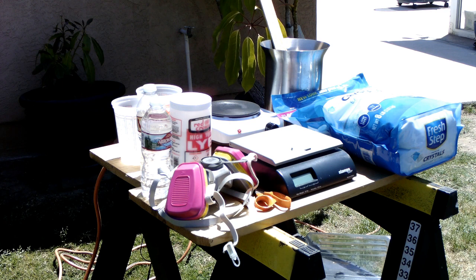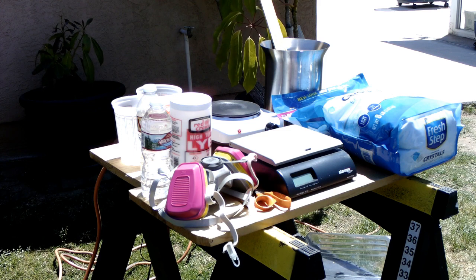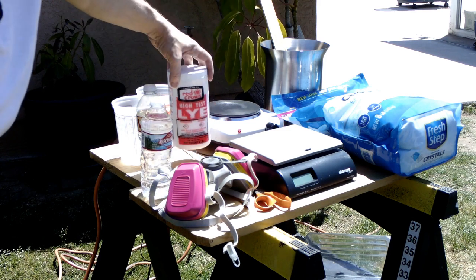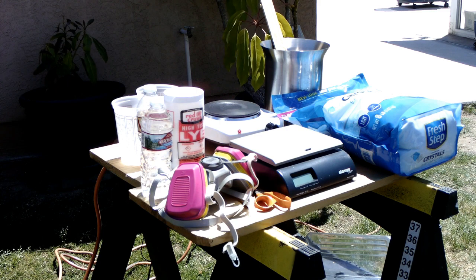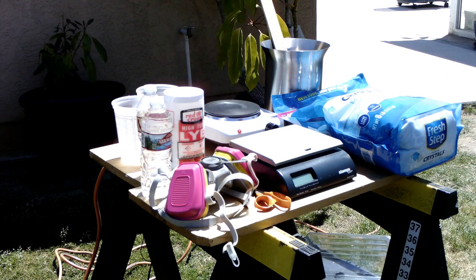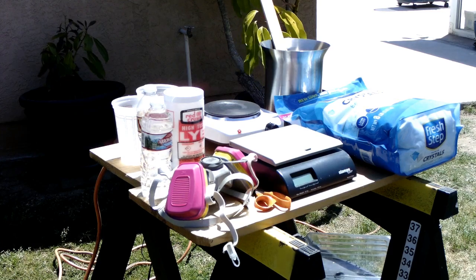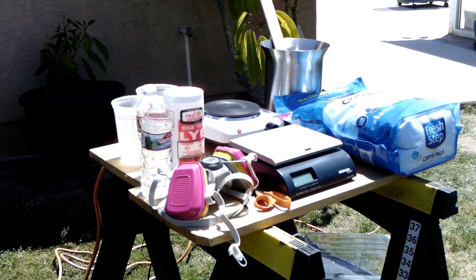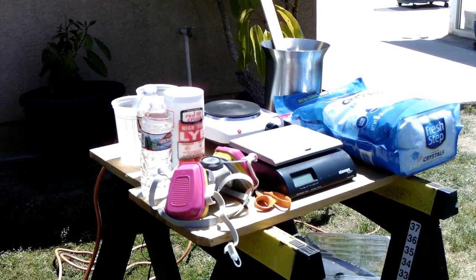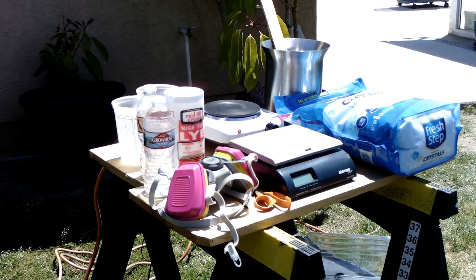To make this, I need 200 grams of lye, or crystal drain opener — this stuff here. I need 300 grams of silica gel, which comes in the form of this silica gel cat litter, as well as 500 milliliters of water. It just happens to be how much water is in one of these bottles.